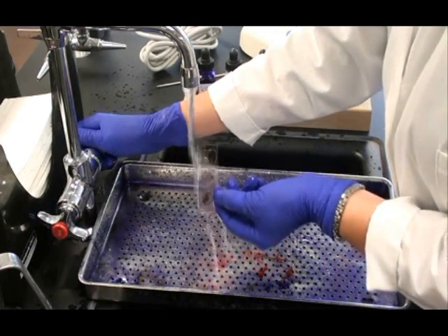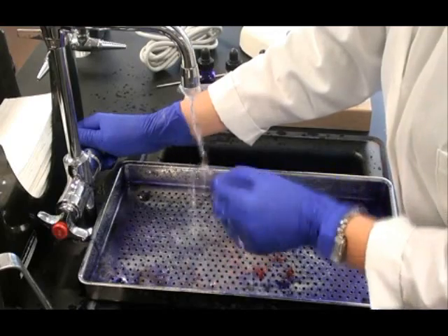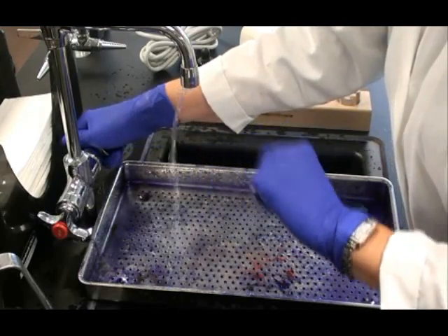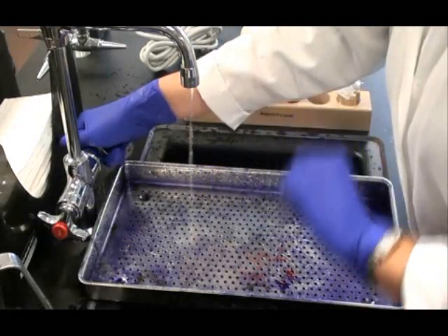At the end of that minute I rinse my slide. This will be the last step. Now let's take a look at it.